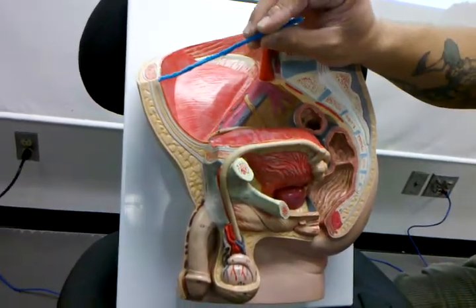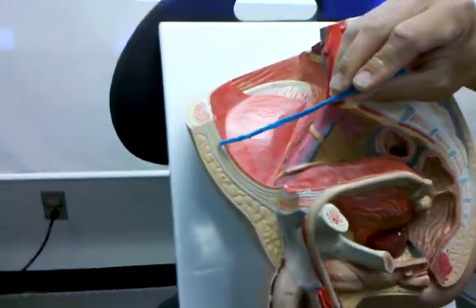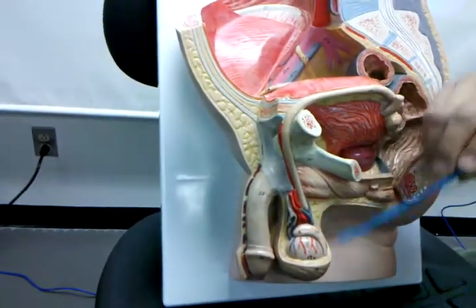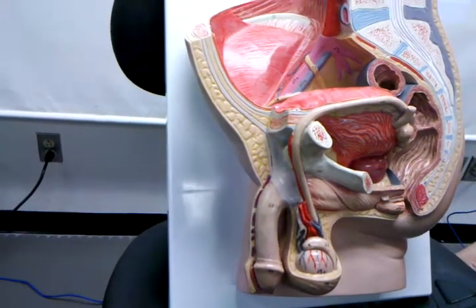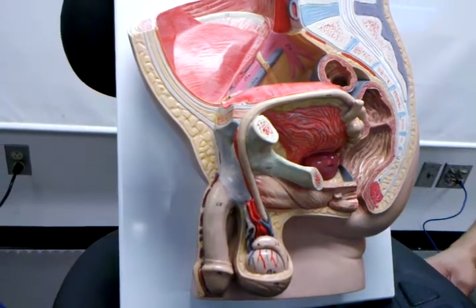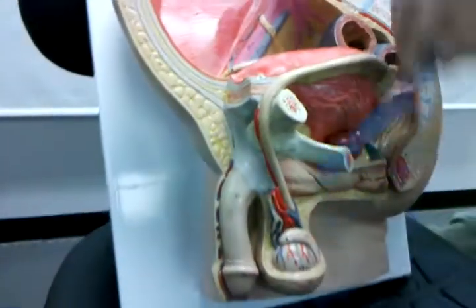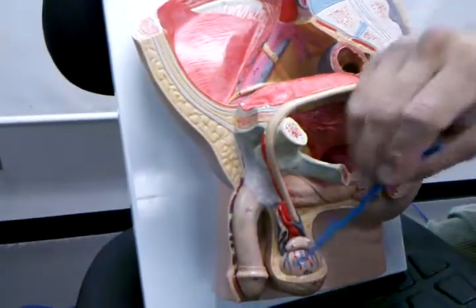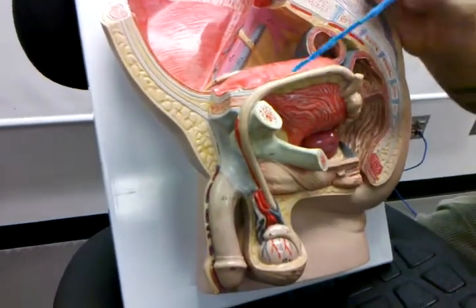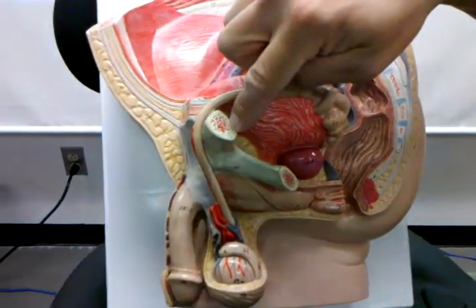If we then do the middle layer on the abdominal wall, it is the internal abdominal oblique. The homolog of the internal abdominal oblique in the scrotum is the cremaster muscle. Now, the interesting thing about the cremaster muscle is it's not just the homolog of the internal abdominal oblique. It's actually little loops of fibers from the internal abdominal oblique, which have been pulled down into the scrotum as the testis descends. So this brings up an important concept.